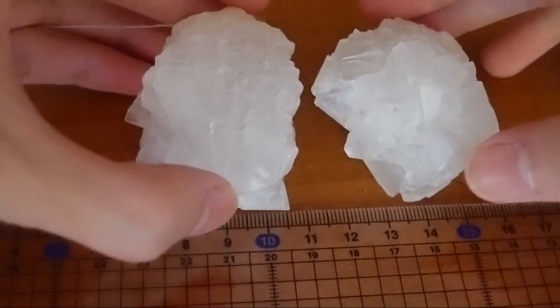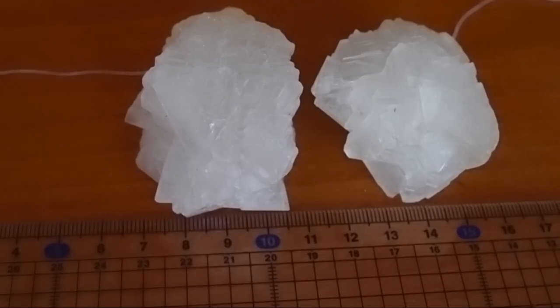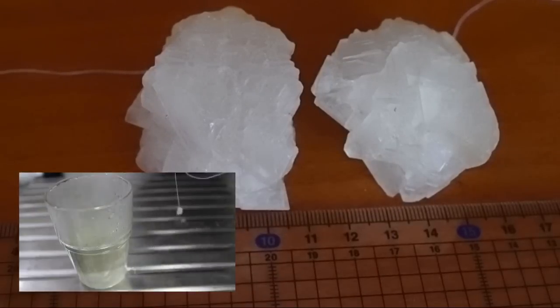Here are the two alum crystals that I made previously. This time I am trying to make a red alum crystal. If you don't know the steps of crystallization, here is the link to the detailed procedures.